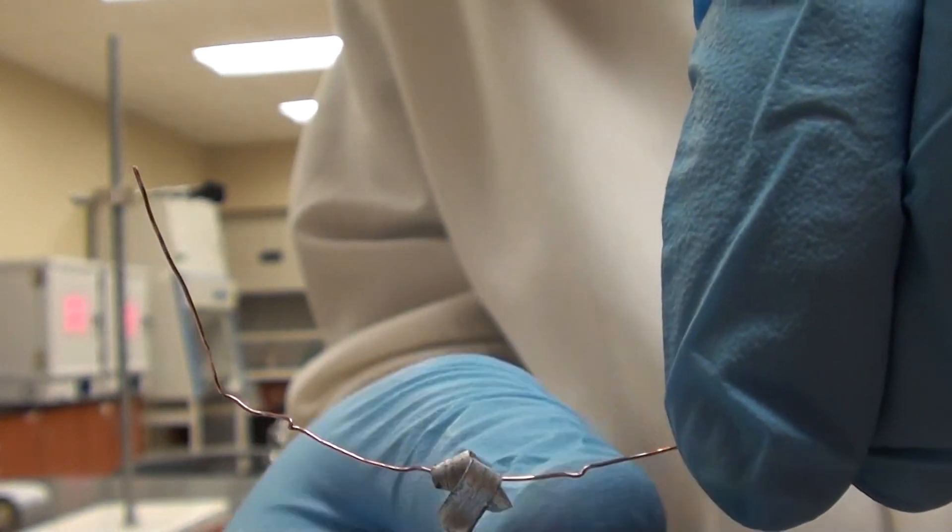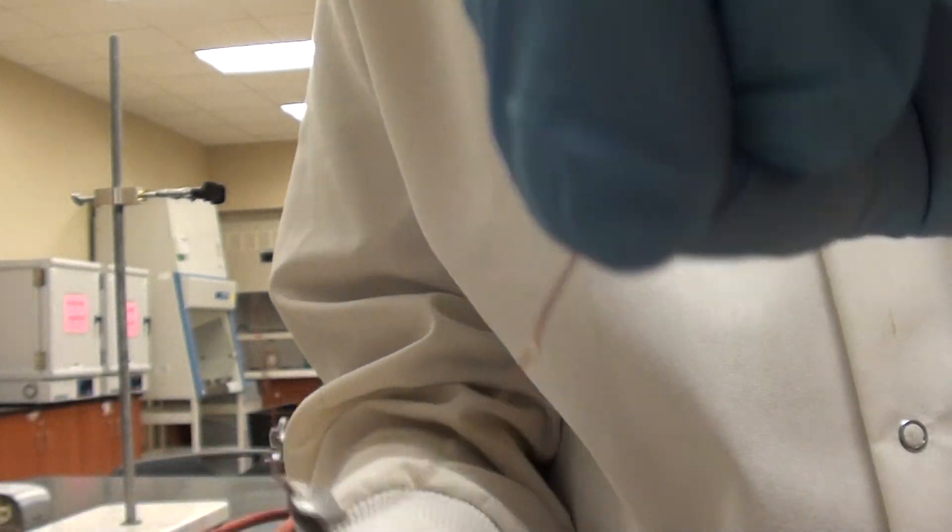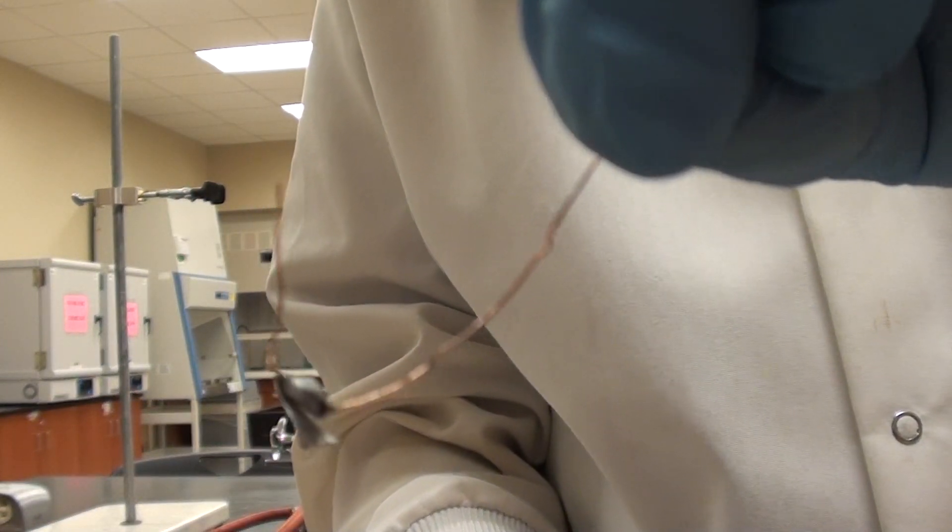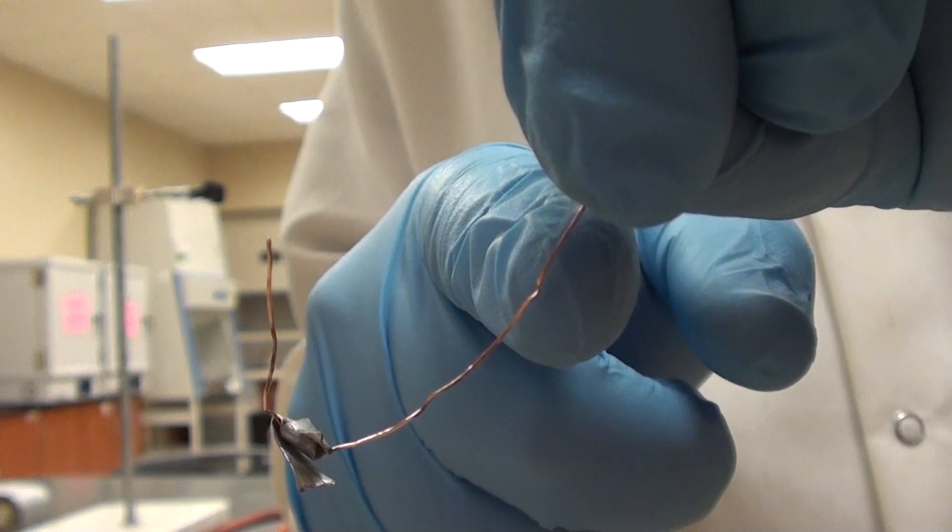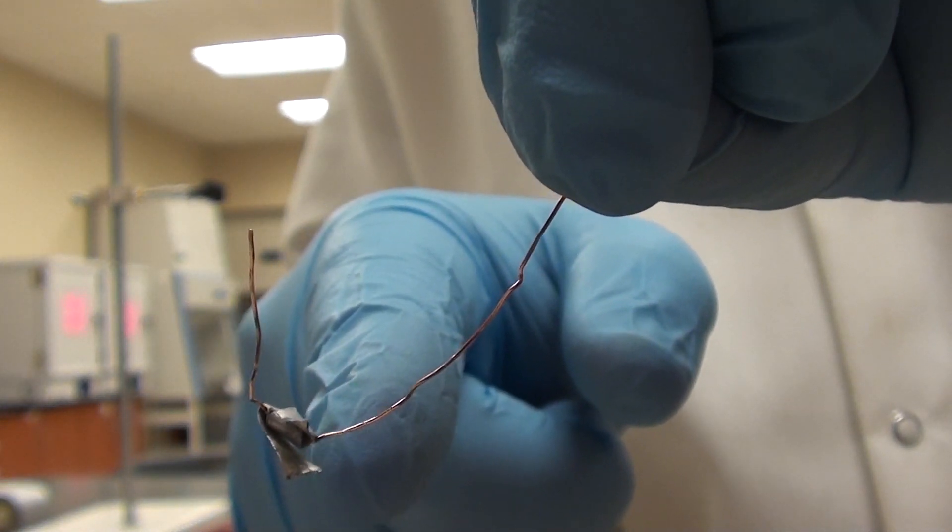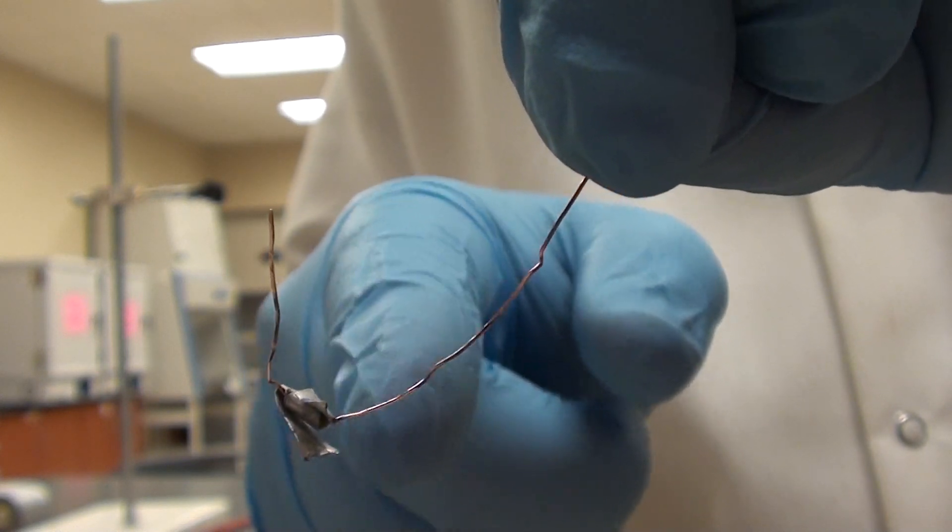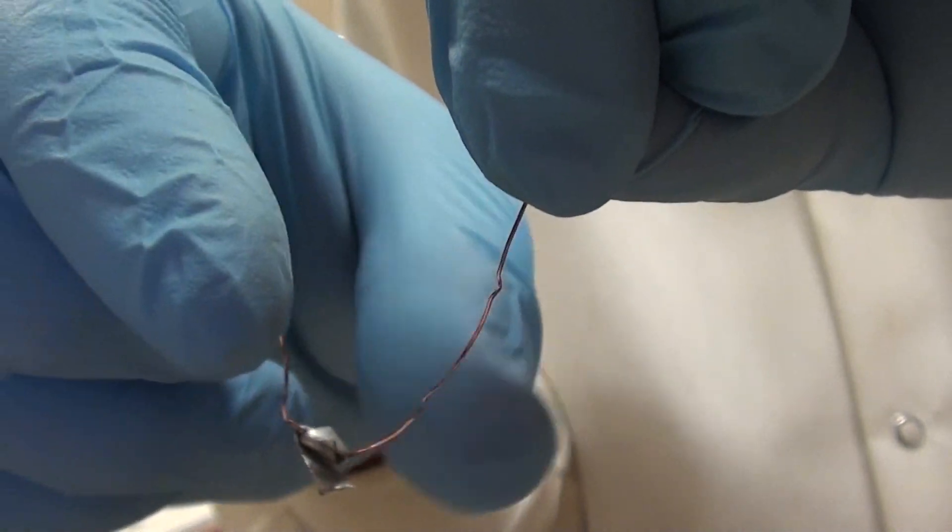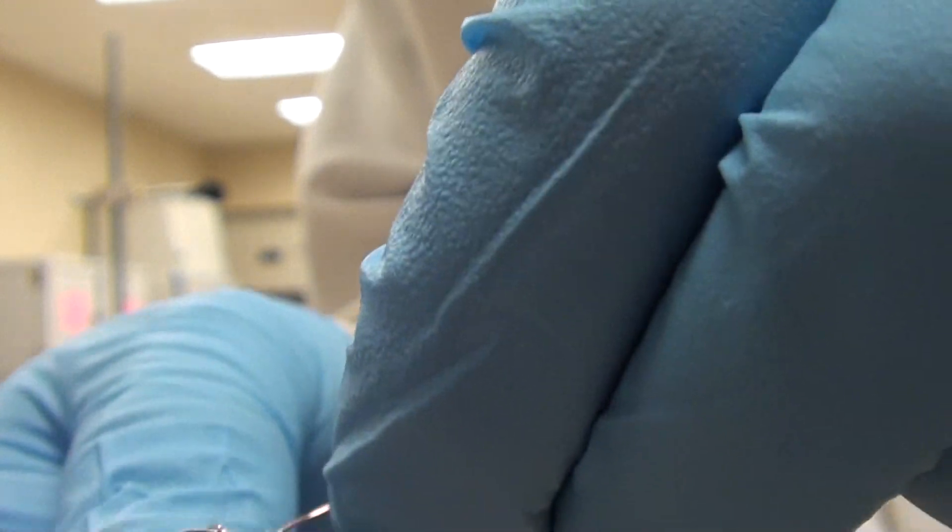So this is what I've got so far. Now what I want to do is I'll take this top part here, I'll wrap it around the magnesium. Then I'll take a bit of the bottom part here and I'll wrap that around the magnesium as well. This is how we'll get this copper cage for our piece of magnesium. This will stop it from floating up to the surface. I'm going to go ahead and start wrapping. I'm just wrapping it around the magnesium.